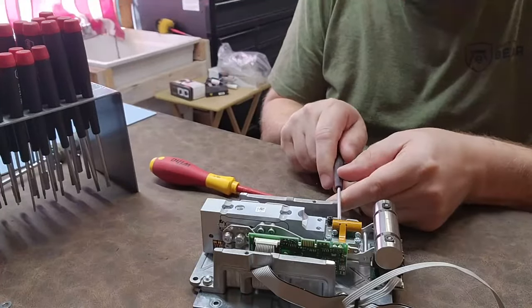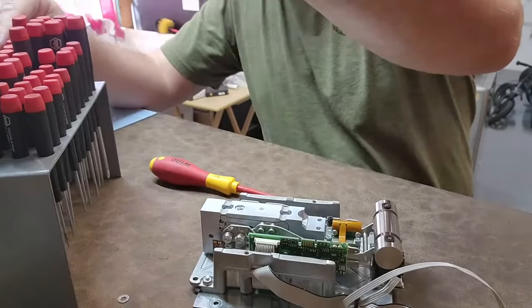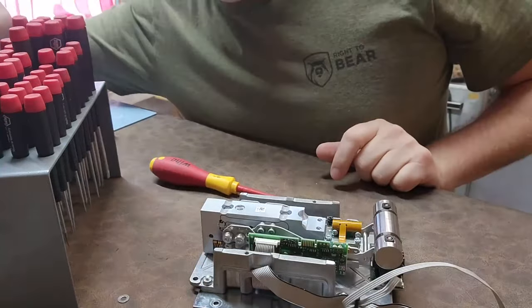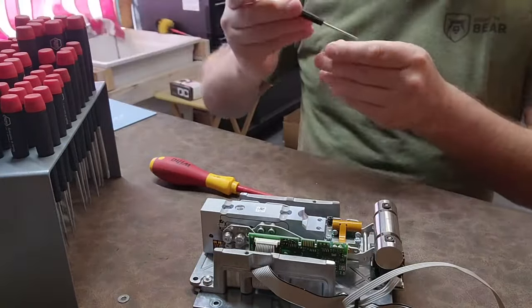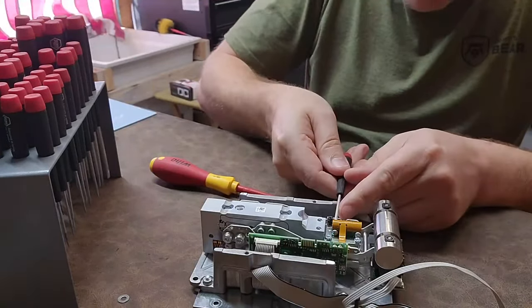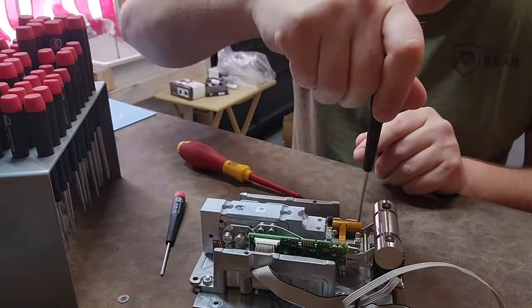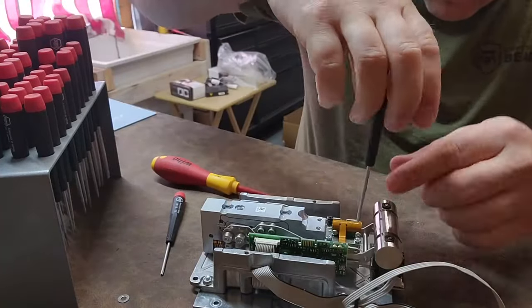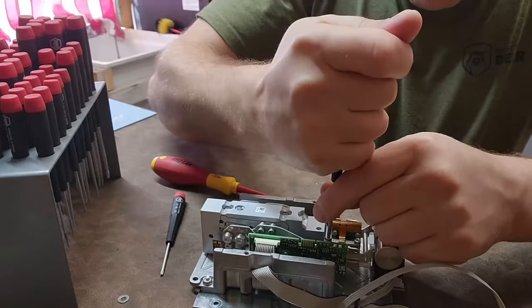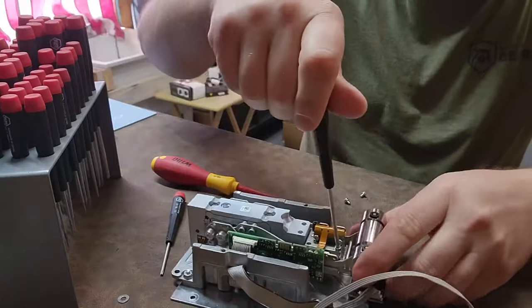Let's see if I can get a smaller one — I really want to take the center out. I'm down to T8 and it is a T8. I'm going to remove the whole plate right here. There are a couple of features on this that are very special to this type of scale and this type of load cell.